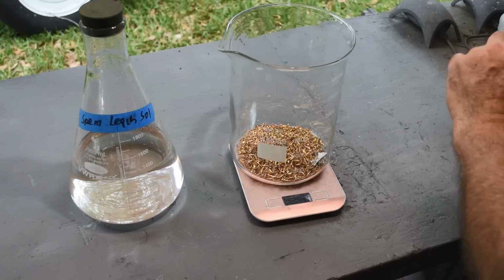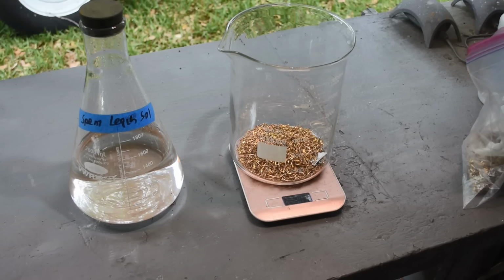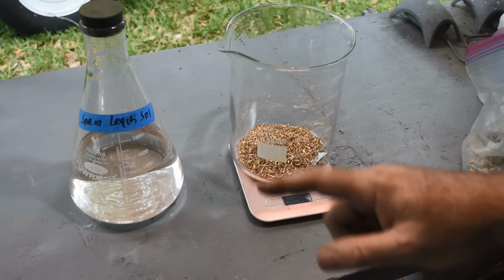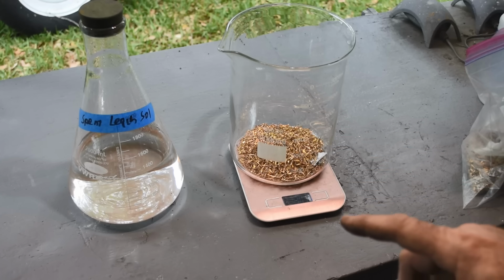Because I already have a lot of sodium iodide and crystal iodine invested in this stuff, and that's kind of pricey. So we'll regenerate this and use it. I'm going to do things a little differently.